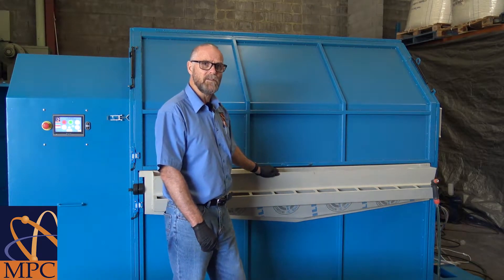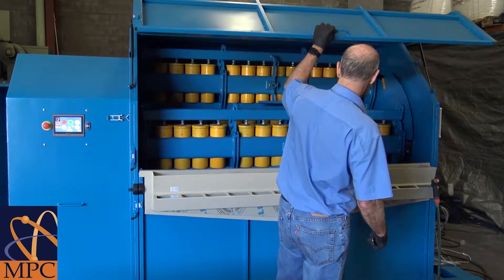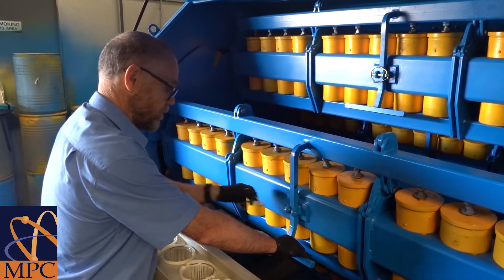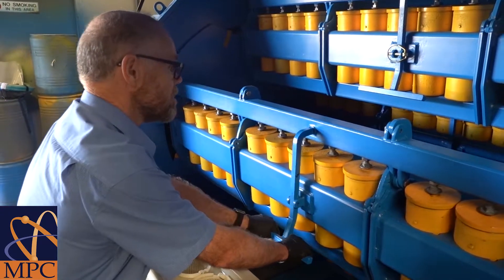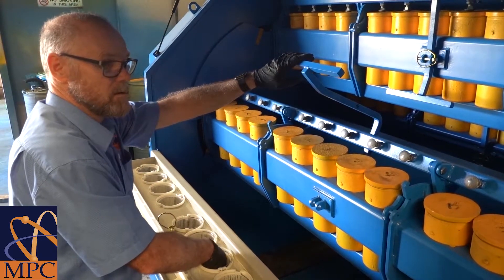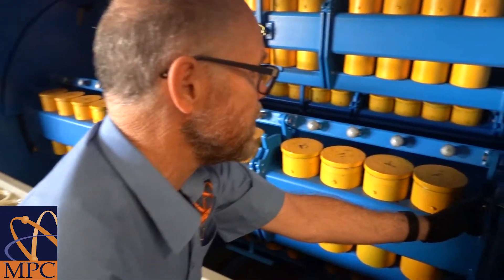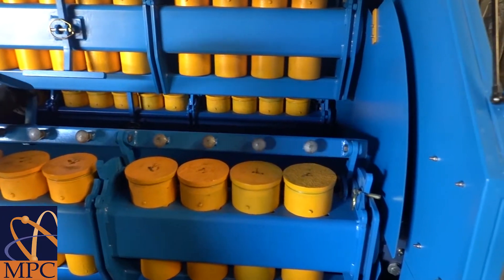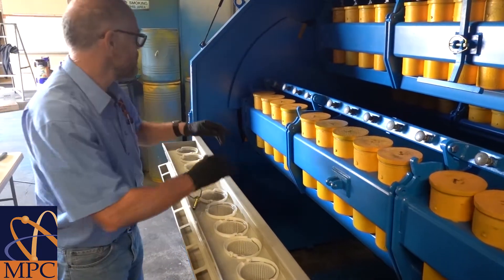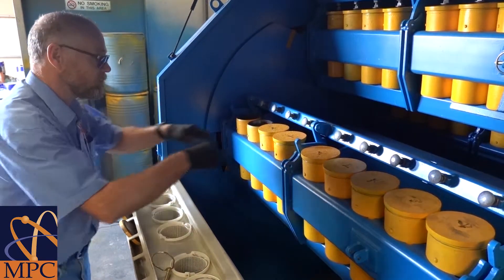The machine has now finished its run. We open the door and open the arms by first removing the locking pin, then open the clamping bar, and place the pin in the arm to stop it falling down on the operator. It's easier at this stage if we remove the arm.